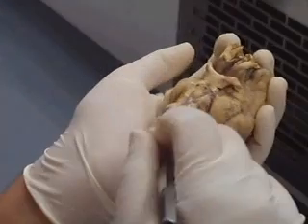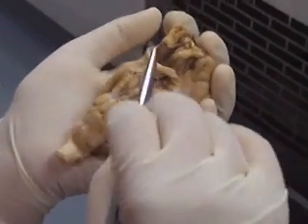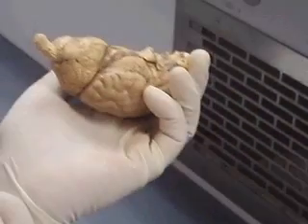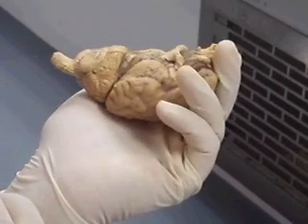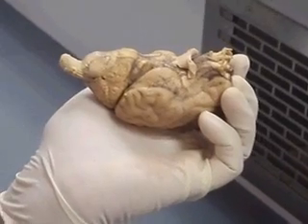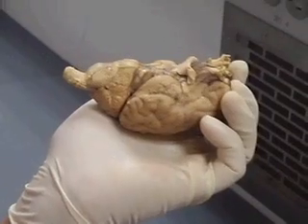You have to know the name, you have to know the function, you have to know the number — what cranial nerve number — all those nerves are. That's it for the brain. Massa intermedia, hypothalamus, corpus callosum, pituitary gland, cerebral aqueduct, medulla oblongata, fourth ventricle, spinal cord, central canal — I talked about all of this.